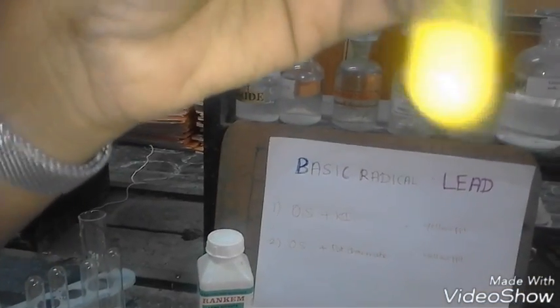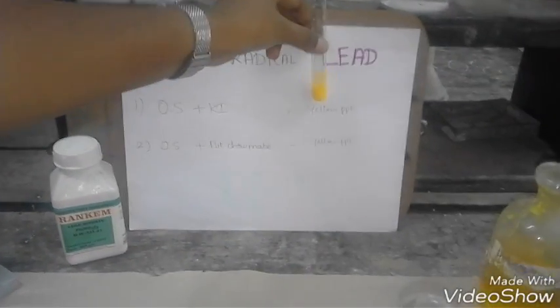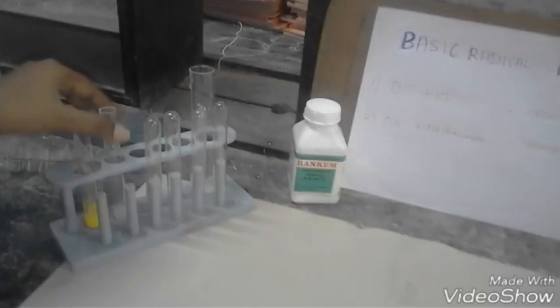The yellow precipitate is formed. It is usually somewhat darker. The yellow precipitate is dark in color. This indicates the presence of lead. I kept it in the test tube stand.